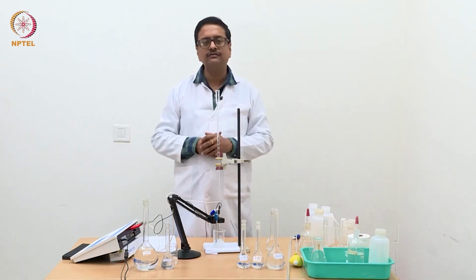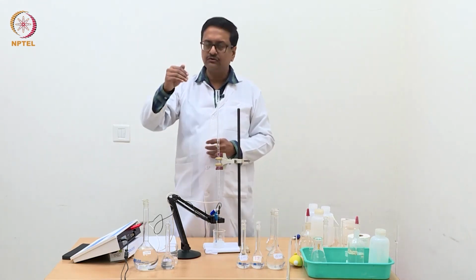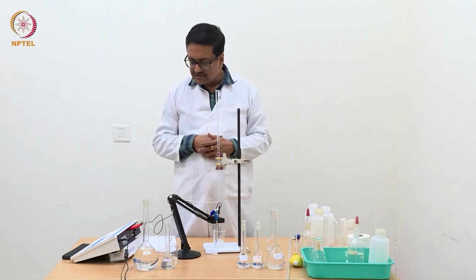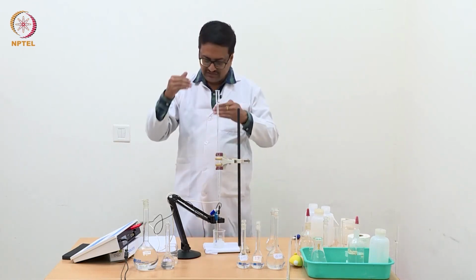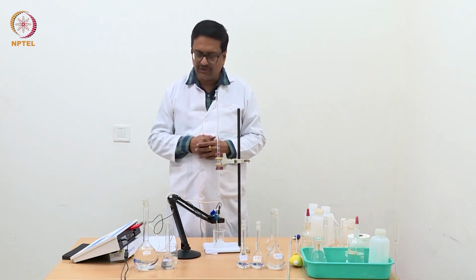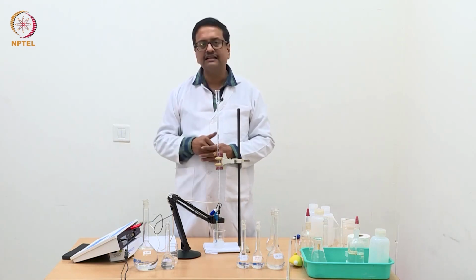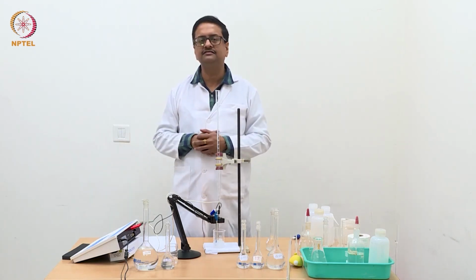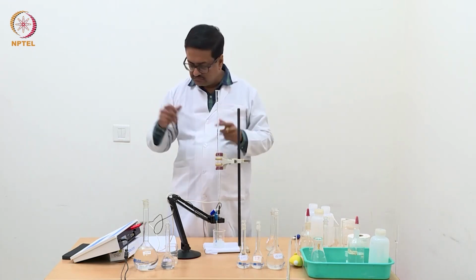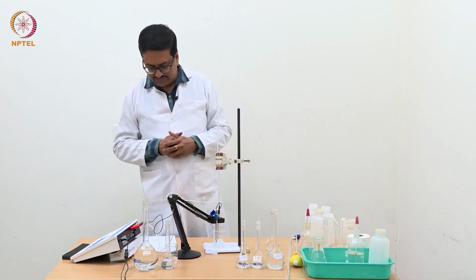If you go back to the previous video, you will see that on addition from 0 to 0.5, 0.5 to 1, there were significant changes in the conductance values, and that is why we had to follow steps of 0.02 or 0.04 ml. But in this case, since the variation is not so much, we can have a larger gap between the two consecutive readings.